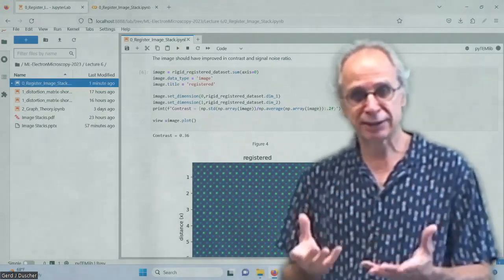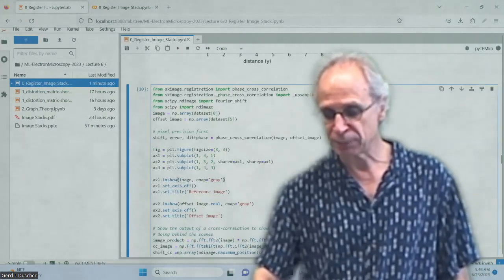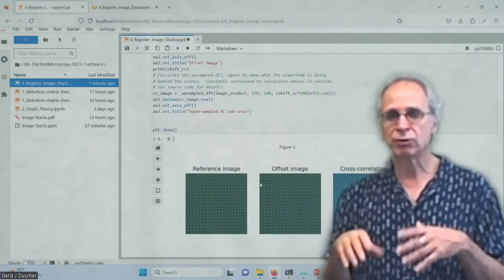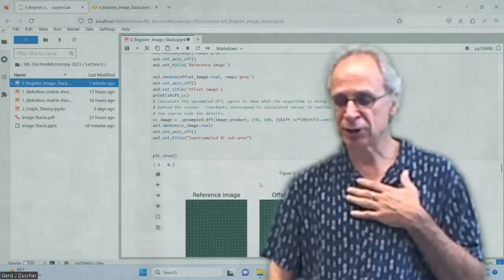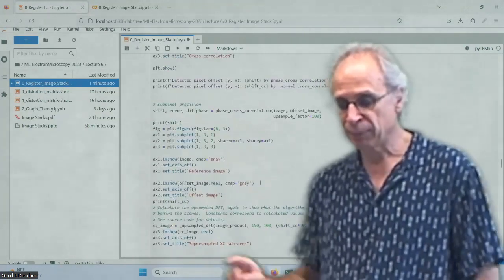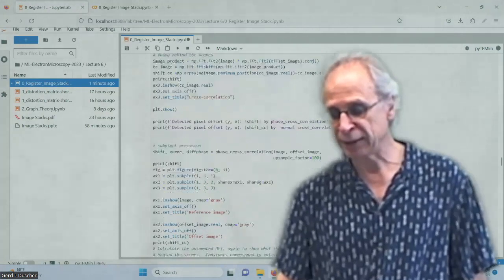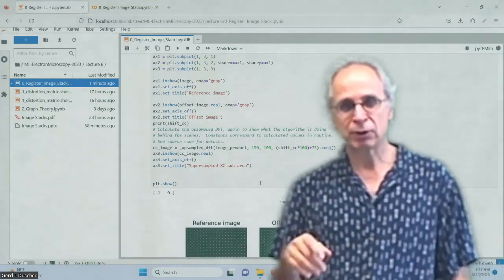So this is a very good data set. So if we now do a non-rigid registration, before we do that, we have to look at what you do if you want subpixel accuracy. I had that in my slides, so I thought I'll share that with you. There is something called phase cross correlation in, say, SciPy spatial, I think, and you can upsample your cross correlation.